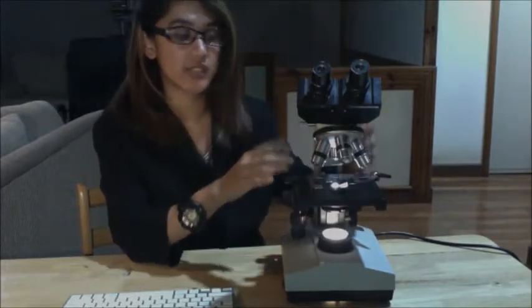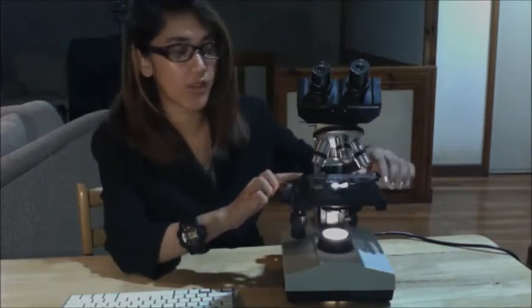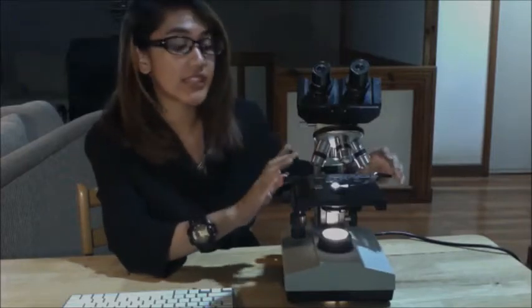Then, place the specimen on the stage. Put the stage down first before you put the specimen in order not to hit any of your objectives. Then next, notice that the slide is held in a clip on the stage, which is this one, with the specimen side up. So the clip is adjustable and it holds the slide firmly in place. So gently pull the clip back and then slip the slide into place on the stage.